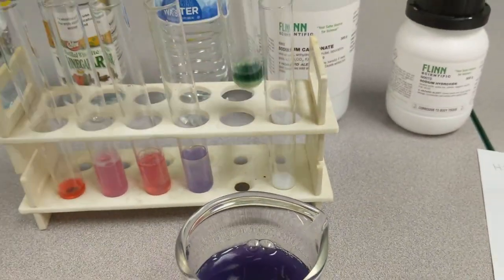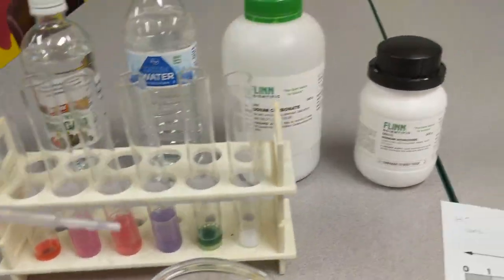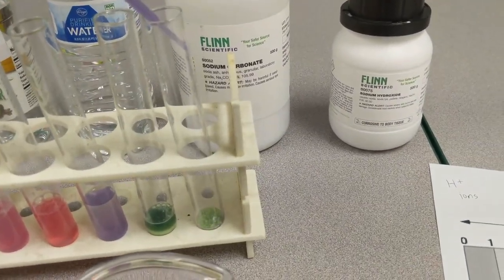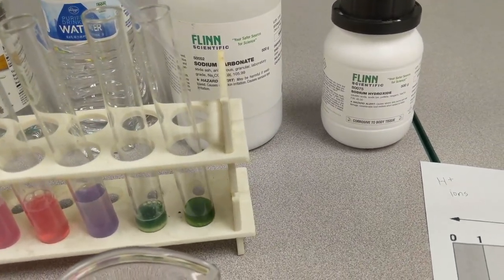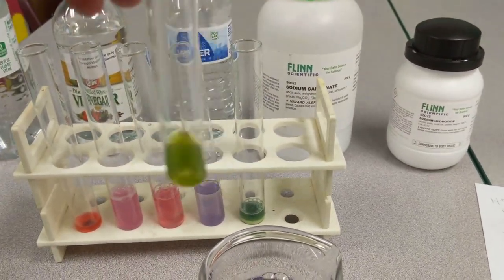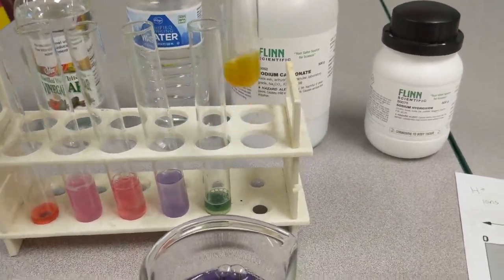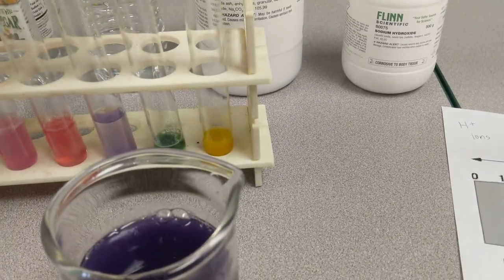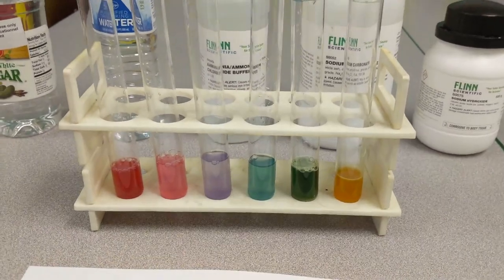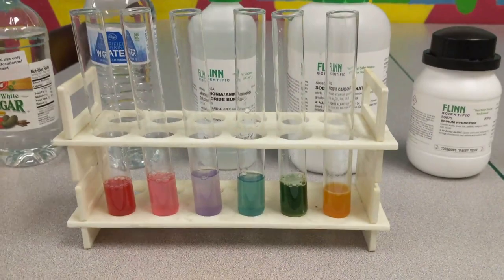Let's go ahead and swirl this one so you can see that green color. What you'll notice is that this one starts out green, but then when I swirl it, it starts to decay into more of a yellow color. Full disclosure, I quickly adjusted some things because I noticed I didn't really get the colors I wanted.